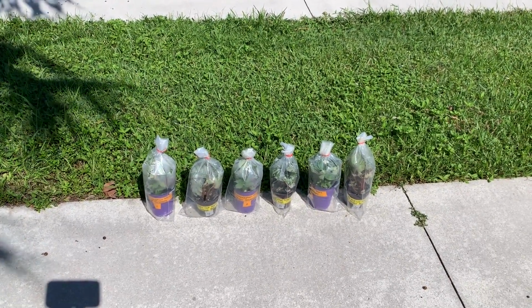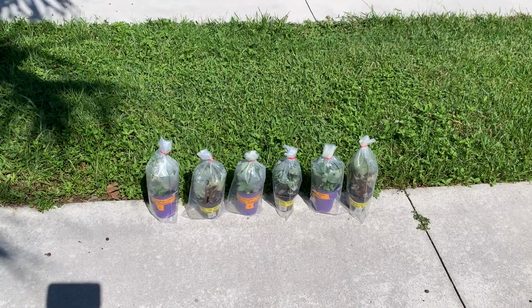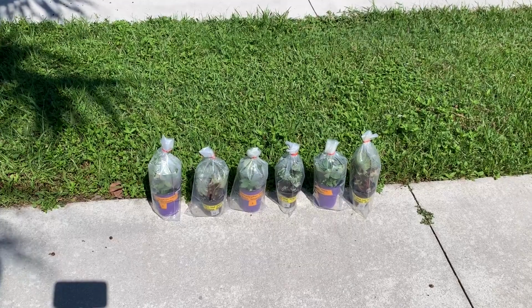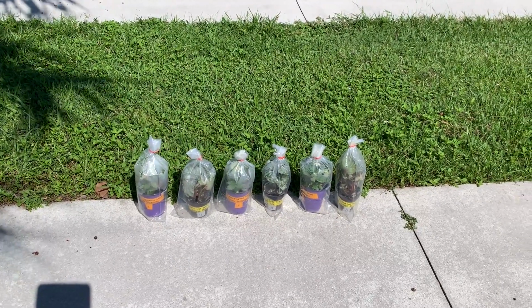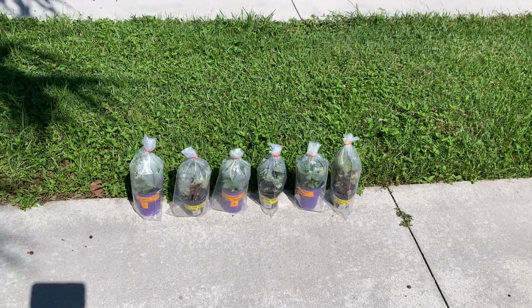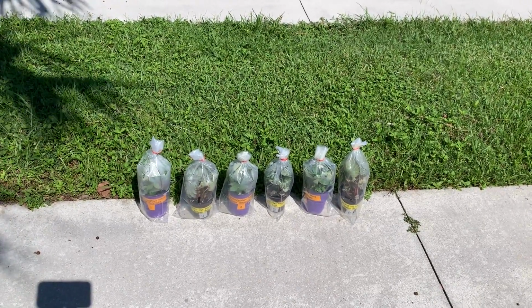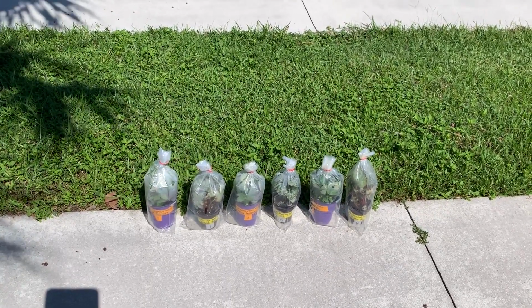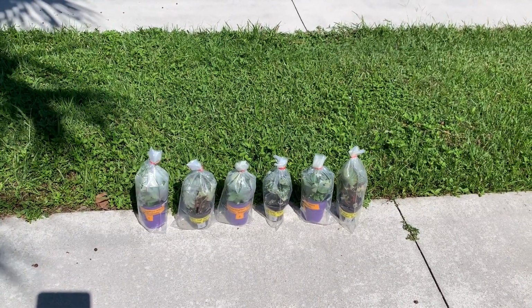Now, of course, this is just a demonstration. If we were doing a true scientific experiment that we wanted to publish results for, we need a more specific methodology and measurements, as well as a higher number of plants or a higher replication. But hopefully we'll see some interesting results from our demonstration today. So I'm going to come back to these plants in an hour to take the second mass.